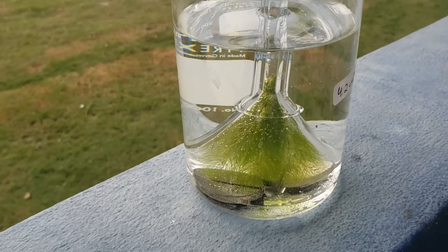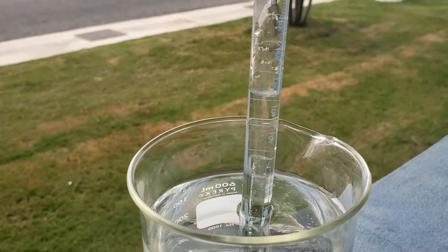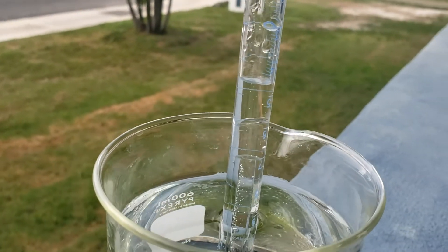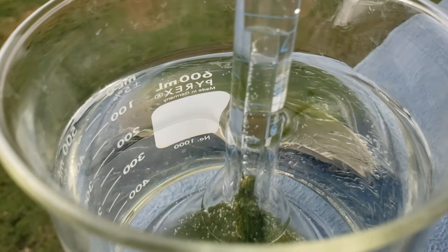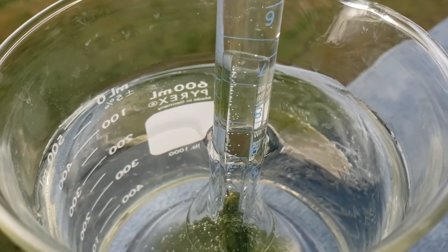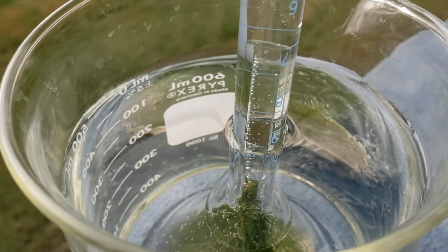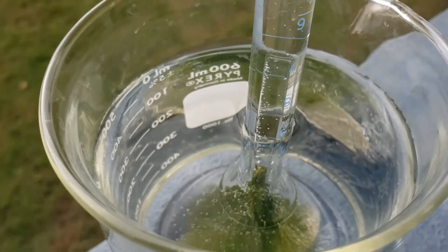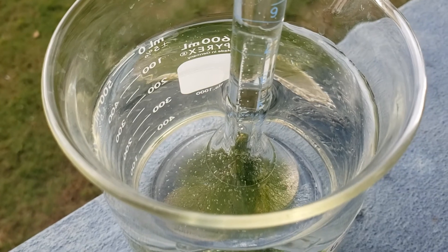Here we take a second look at the beaker placed outside in direct sunlight, and we can see that there are still bubbles being produced. In some experiments, what you can do is actually count the number of bubbles produced in a minute, and that could also be a measure of the rate of photosynthesis.